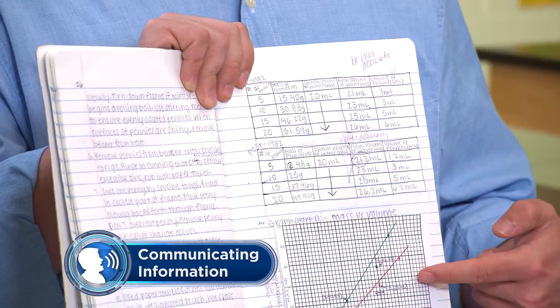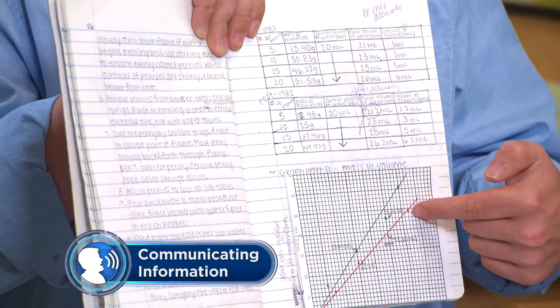As you finish gathering and analyzing data, it's time to start discussing your results. So who wants to go first? We graphed the mass on the y-axis and the volume on the x-axis, then we calculated the slope of a best-fit line for the pre- and post-1982 pennies. The slope gave us the average density for each set of pennies. The average density of the pennies from before 1982 seemed to match the density of copper on the reference chart, while the pennies made after 1982 had the density that matched zinc. Here's our evidence: the slope of our line showed that the pennies made before 1982 had an average density of 8.85 grams per milliliter, which is really close to the known density of copper.